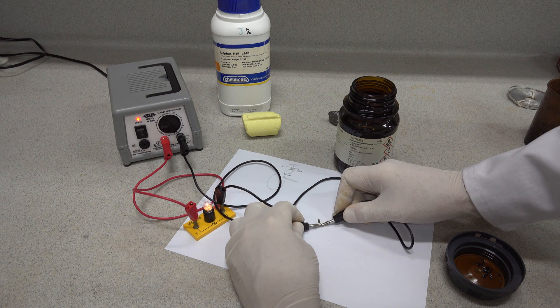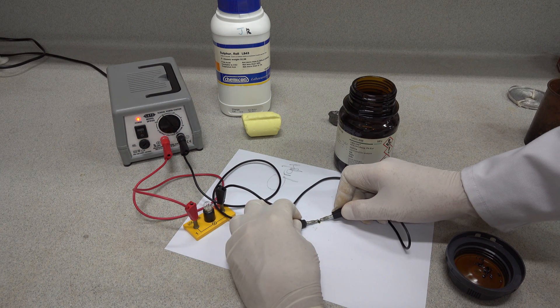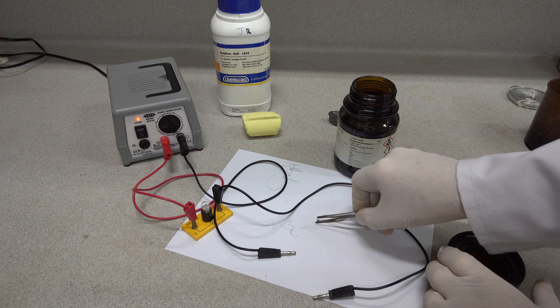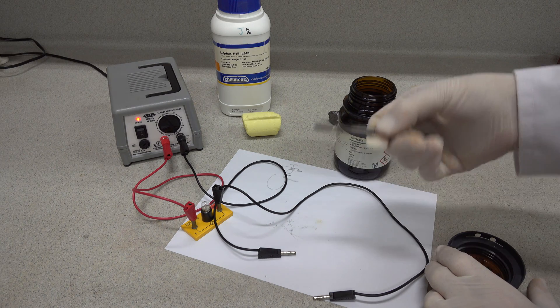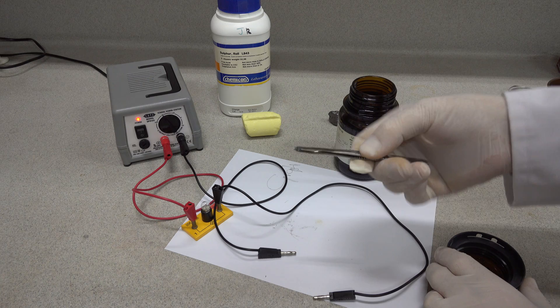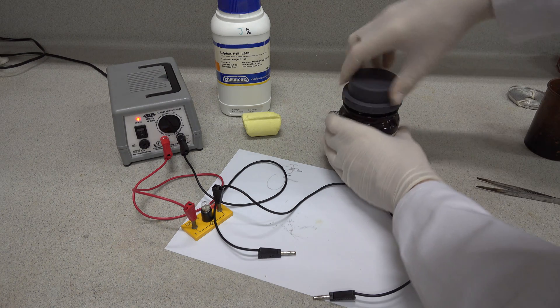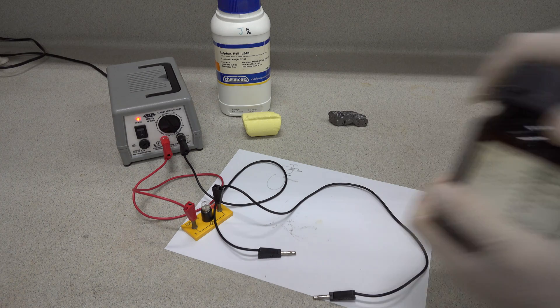Let's just bring the contacts together - yes - but with the iodine between them, no. So iodine does not conduct electricity, but it is a bright, shiny, greyish silver, some say purple solid. So that was iodine.